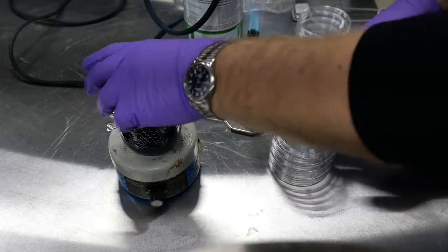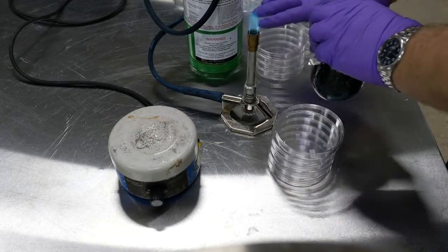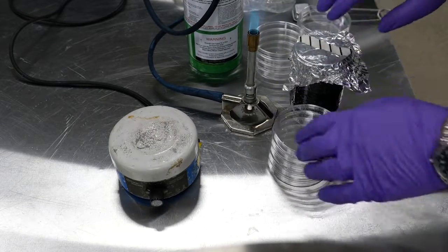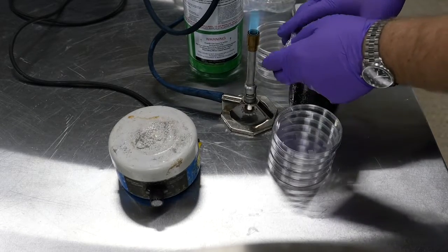So I'm going to pour the first round of plates. I'm going to try to keep everything within a foot of this flame, just to make sure that there's nothing floating in and landing in our agar from the outside environment.